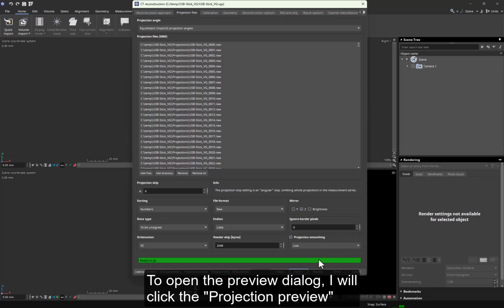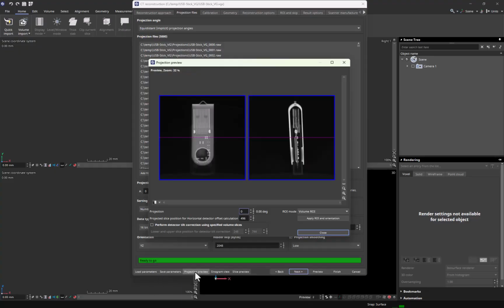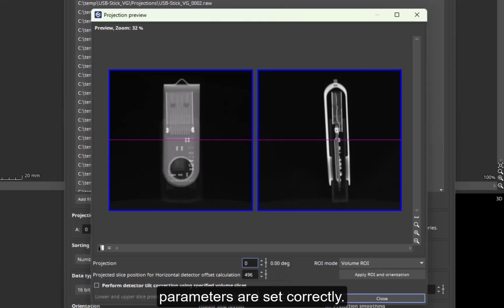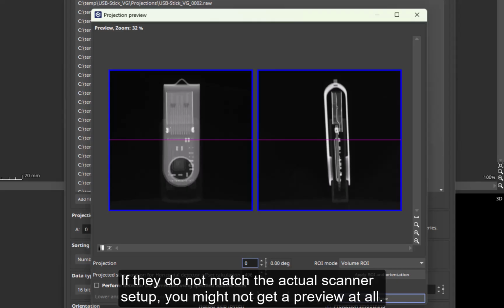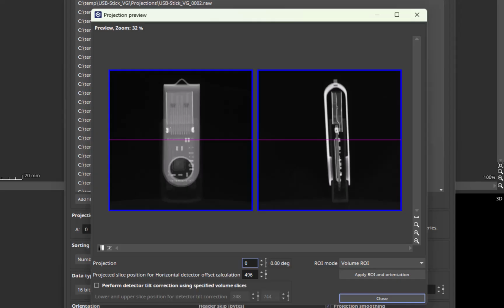To open the preview dialog, I will click the Projection Preview button here at the bottom of the CT Reconstruction dialog. The projection preview gives you a first impression of whether the reconstruction parameters are set correctly. If they do not match the actual scanner setup, you might not get a preview at all. The preview section shows two orthogonal projection images surrounded by blue frames.